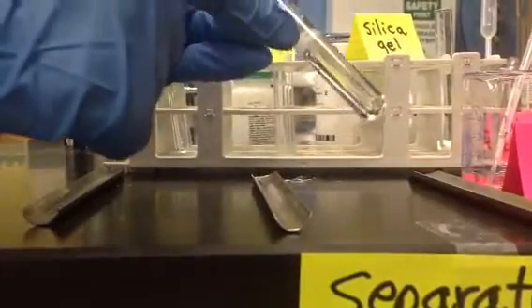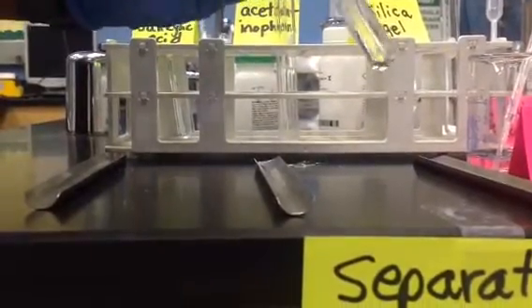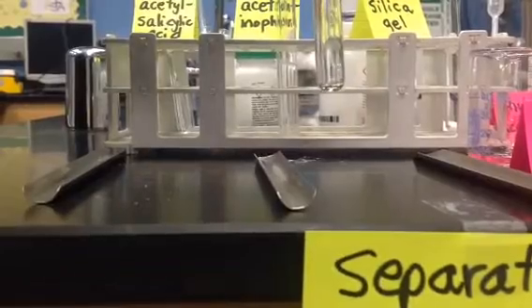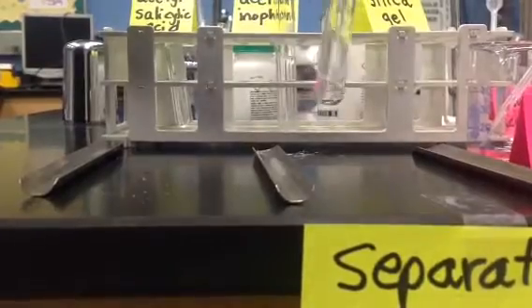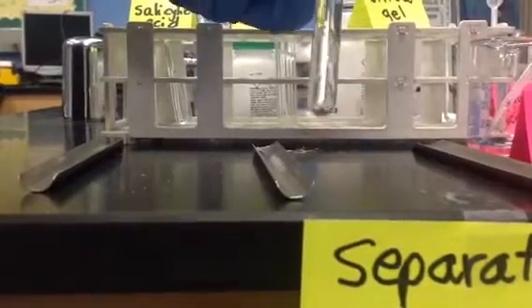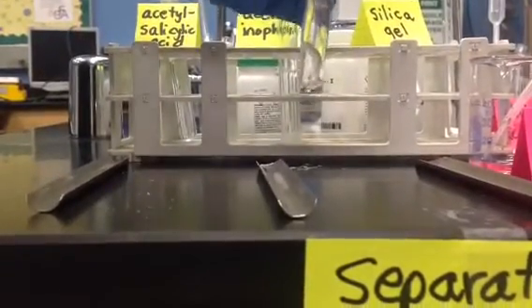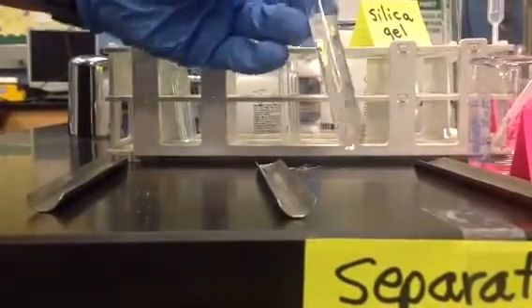And definitely we had more whitish particles on that acetylsalicylic acid than I'm seeing right now. So let's add a little more sodium bicarbonate. See if we can't get all that to dissolve. Yeah. And you should be seeing a difference from when I first started adding it. So it's definitely, we're having to work to get it to dissolve, but it is soluble.